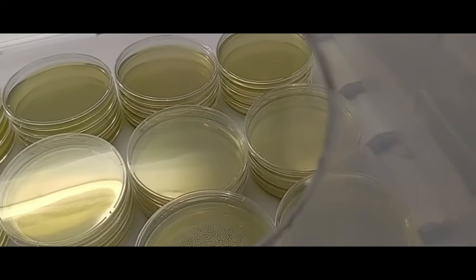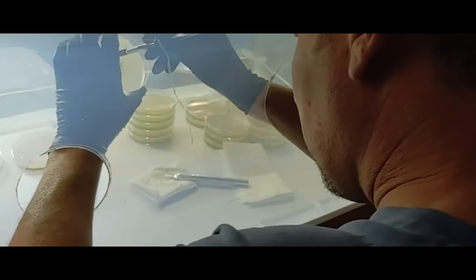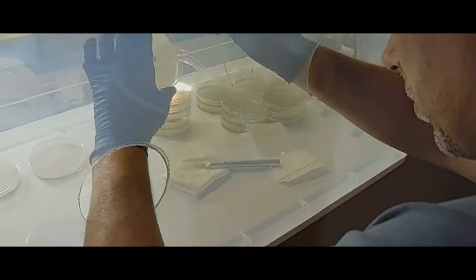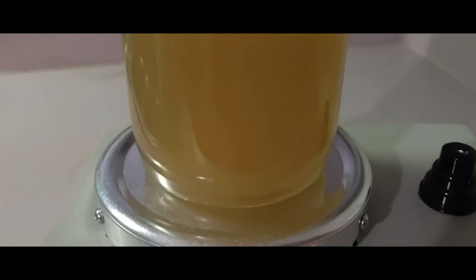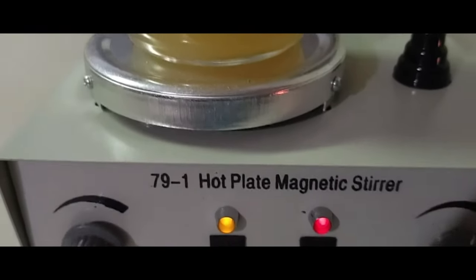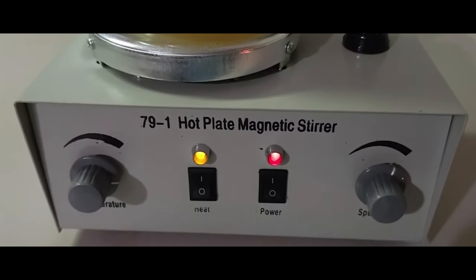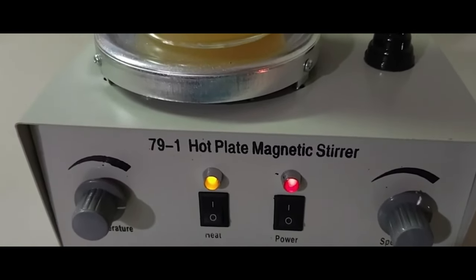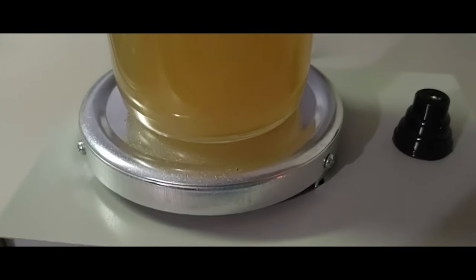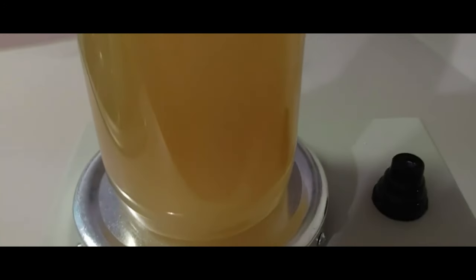The great thing we have discovered with malt extract is you can adjust the amount of nutrients and dextrose according to how much you want to feed your cultures. We started with the standard 10-gram agar, 10-gram malt extract per 500 milliliters of purified water and definitely got quick tomentose growth, but it was hard to determine what was good mycelium and what was possible contamination.